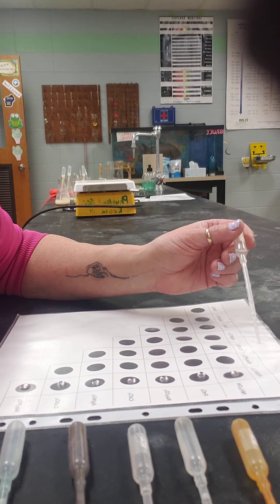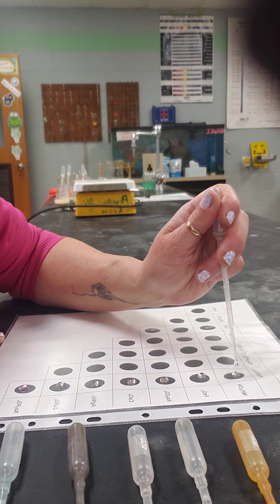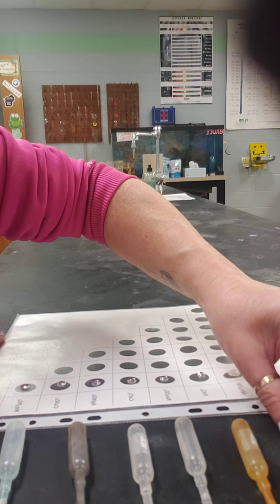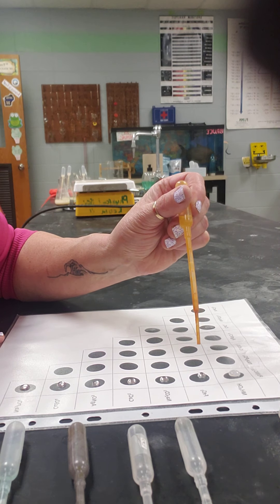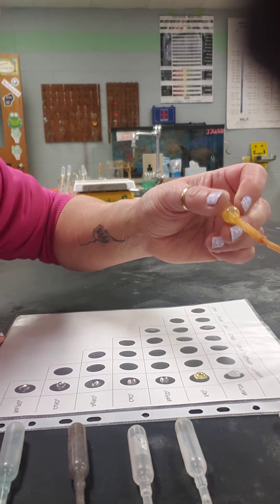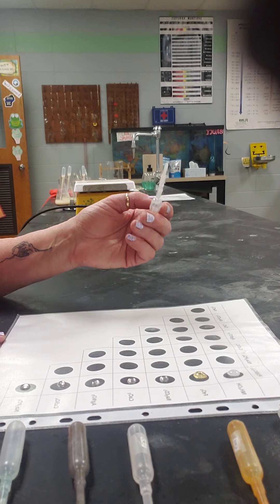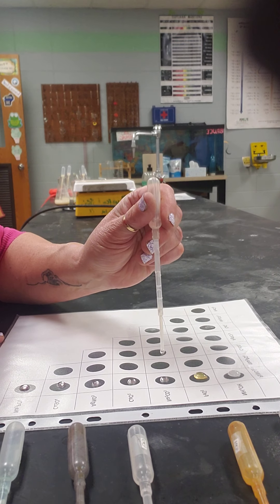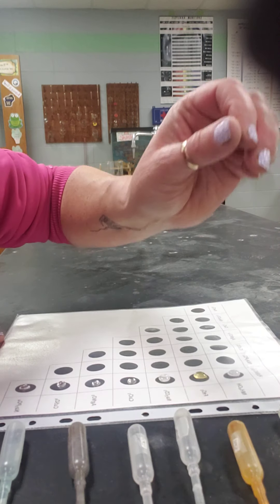My first compound I'm going to mix with lead(II) nitrate is ammonium hydroxide. Can you see what happened? It turned white — there's a precipitate. Then I'm going to mix the next drop of lead(II) nitrate with iron(III) chloride. There's another precipitate.